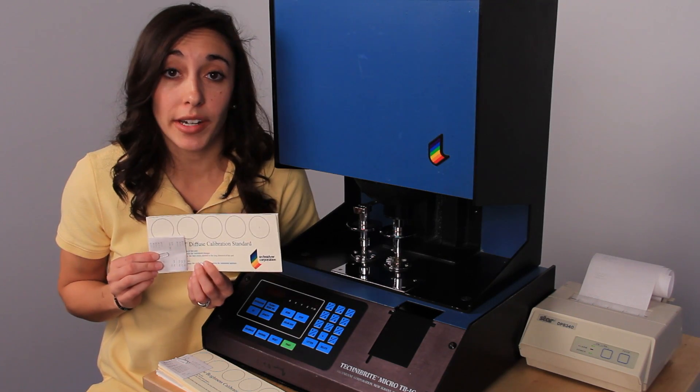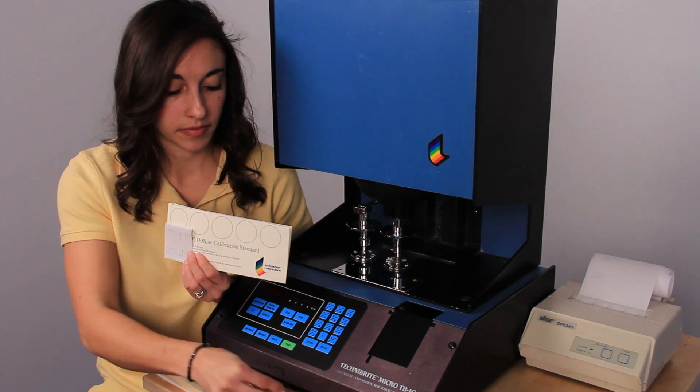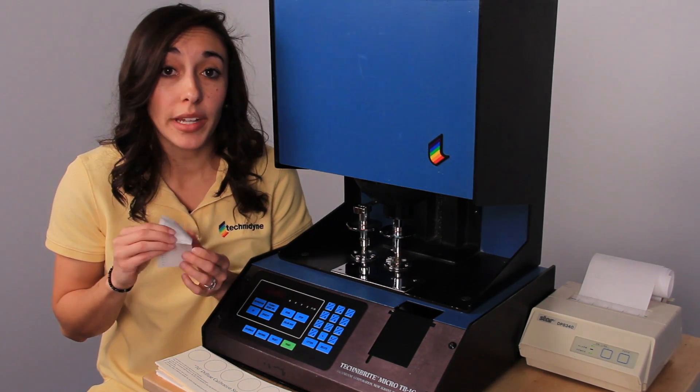Because 70 is going to be our primary standard, we can go ahead and take that paperclip off and hold on to this printout, since that's what we'll be using in our next step.